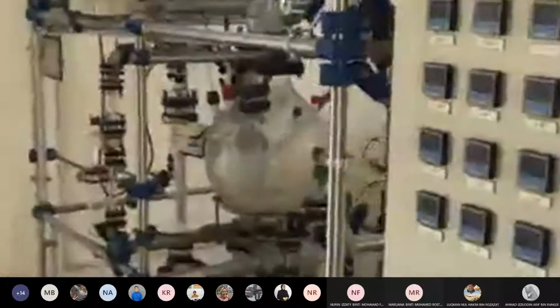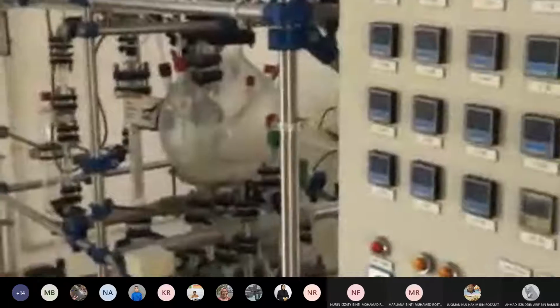So this lab 8, the common name we call it is the unit operation laboratory, meaning all the pure chemical engineering courses, for example reaction, separation, thermodynamics, reaction and separations, all the apparatus are here. Okay, so I think I show you in general first. This one is actually distillation. So when you learn separation, this is the distillation unit. So it's mixed, it has separation and reaction apparatus all here.